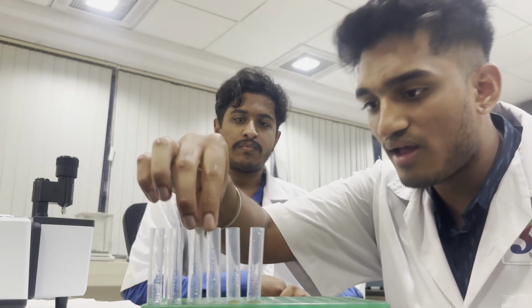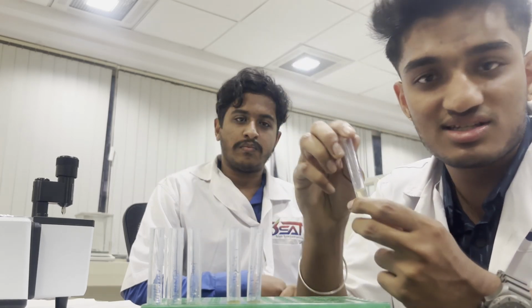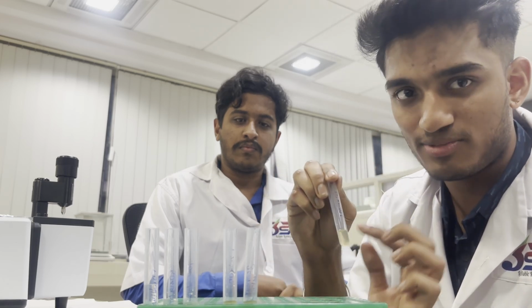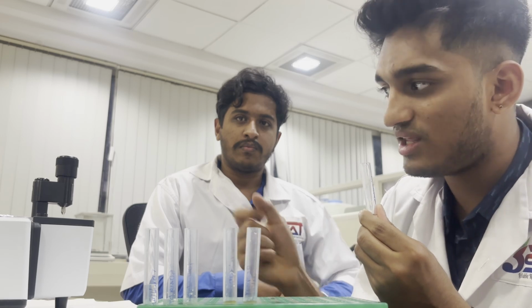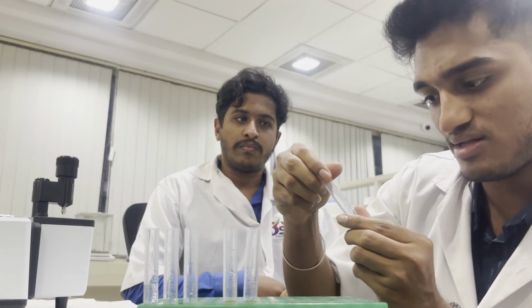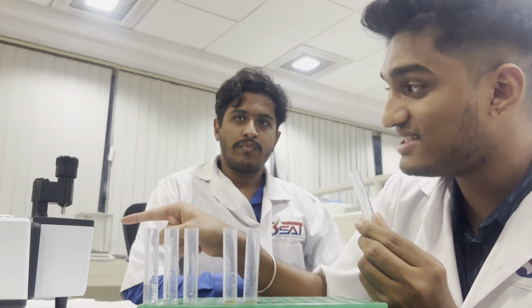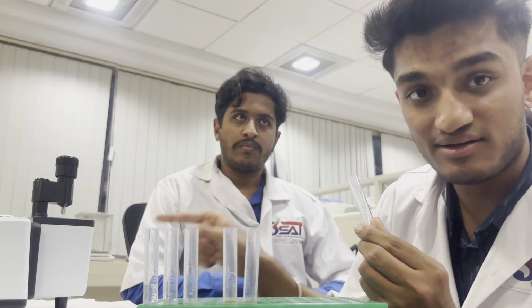I want to show you one sample, which is the unknown sample. I know, and he knows, that it is 360 mg per ml, but the FTIR doesn't know. In the video, I'll show you what it is, and we will see whether this FTIR can actually find it out or not. So let's get to the video.